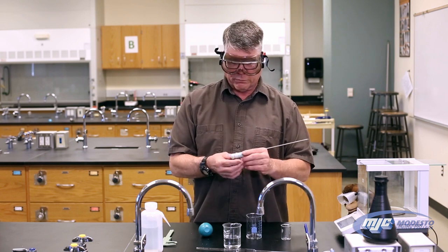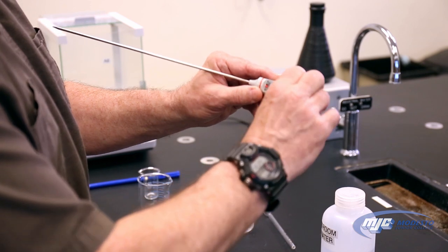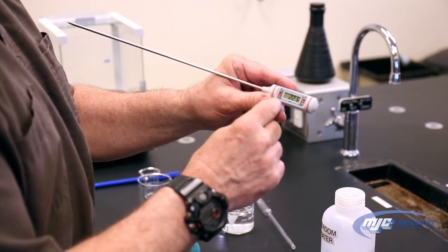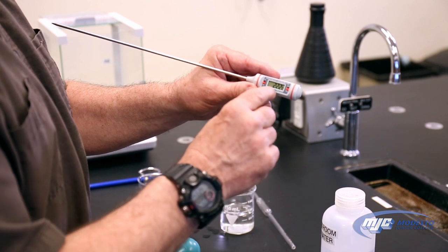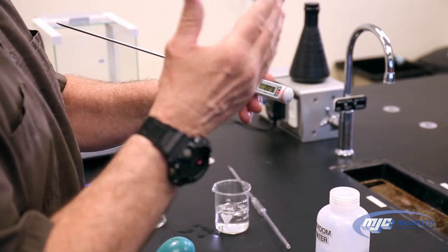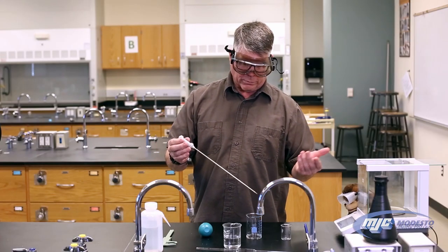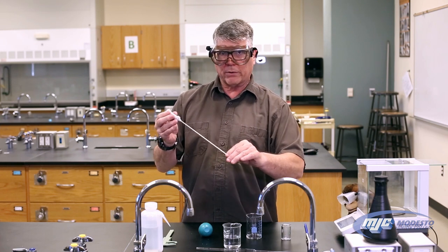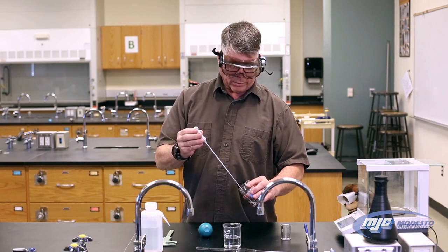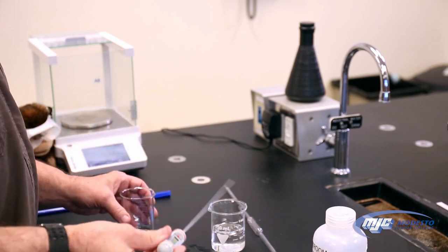Place the beaker back on the balance, close the doors, and read that number three past the decimal — that's the mass of your first 10 milliliters of water, which should be just under 10 grams. Repeat that four more times. After each measurement, pour the water into a larger beaker, dry out the small beaker, and repeat. At the end of five measurements you should have about 50 milliliters of water. Then take a digital thermometer and measure the temperature — one decimal place in Celsius. Hold it by the plastic part, put it in the water, try not to touch the bottom, let it equilibrate, and write that number down. That's all there is for the first part.